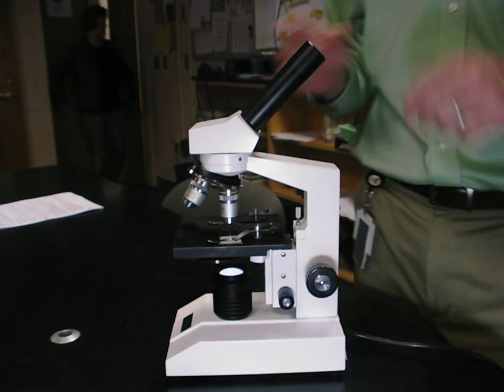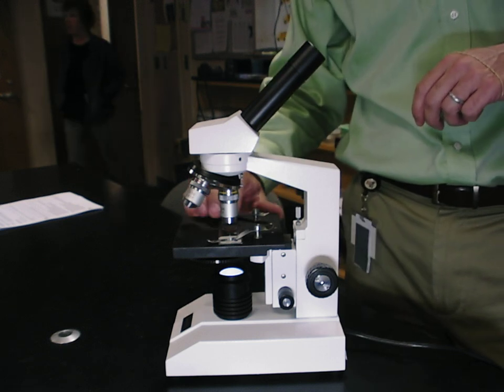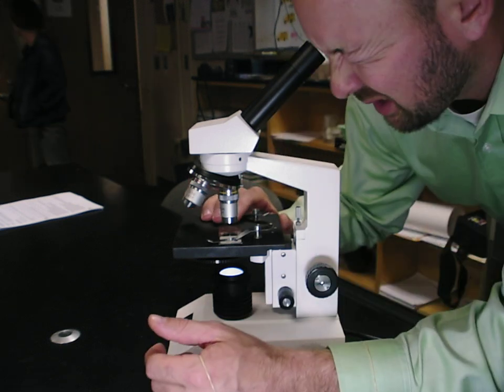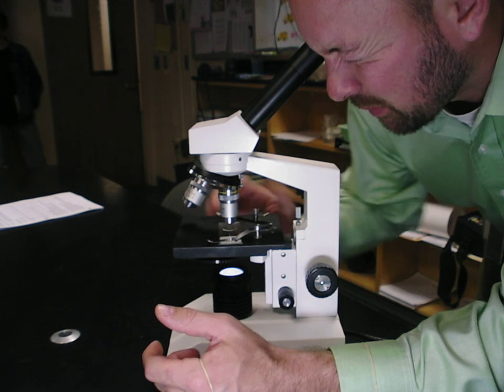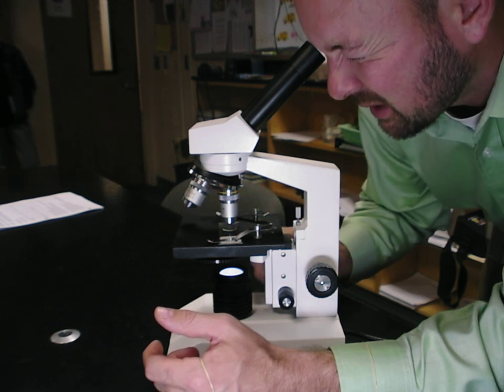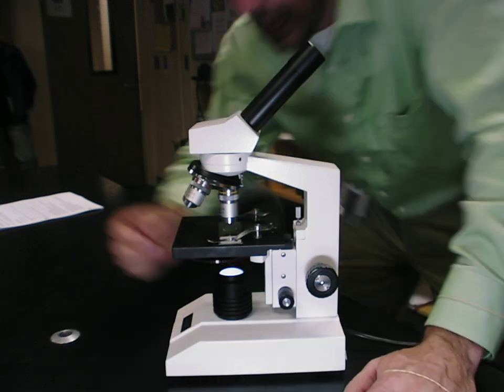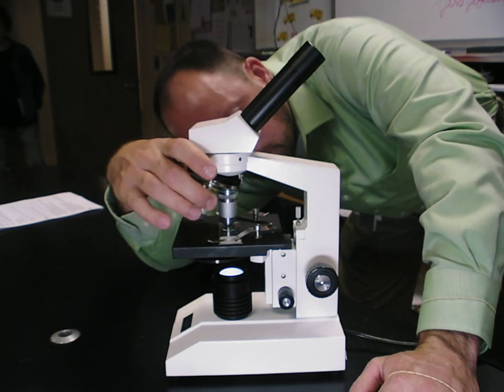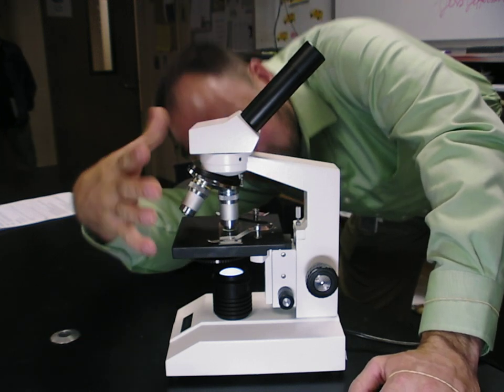Center it here on whatever you want. So move this around if you have to, to center it. It says for the cork to do it by the edges. So find a good piece, focus it again, then again, looking from the side so that it doesn't bump, which it doesn't. Change it.